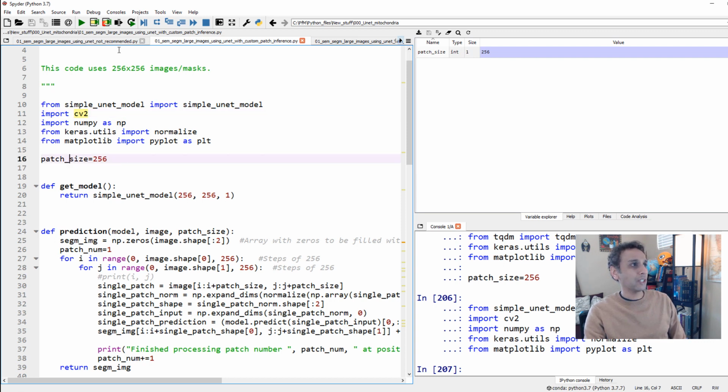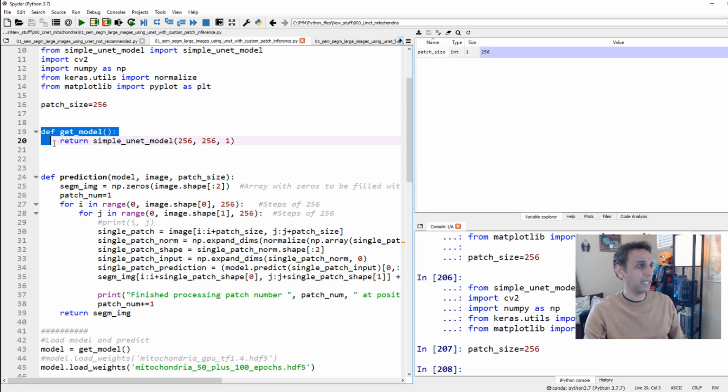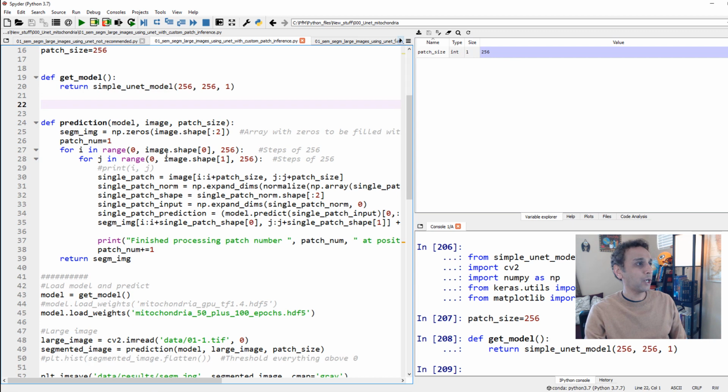Let's define a patch size of 256 because the plan here is to take our large image and divide that into patches of 256, predict on these patches, and then stitch them back together. That's pretty much it. And let's go ahead and get our model again by defining our width and height as 256. And now let's go ahead and write a function for prediction. You can do this any way you want. But in this case, I'm just going through two for loops.